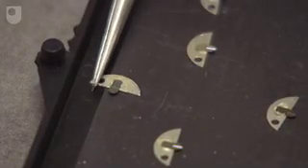The tips are very small indeed and can't really be seen by the naked eye, so they come to us mounted on a semi-circular metal plate, which makes handling easier.